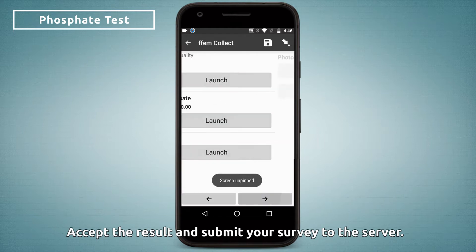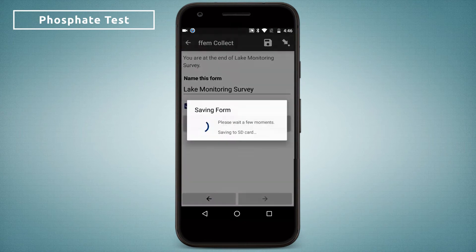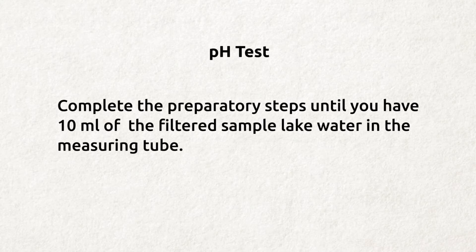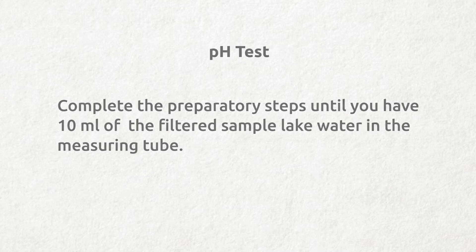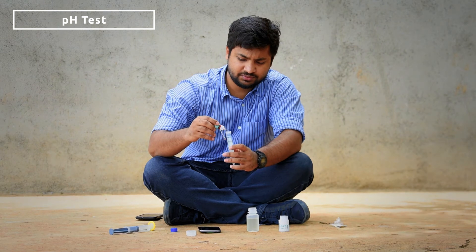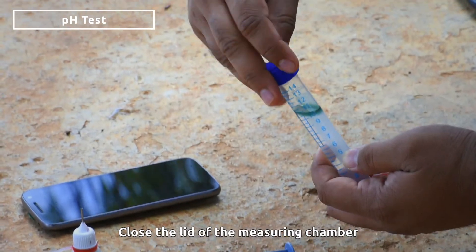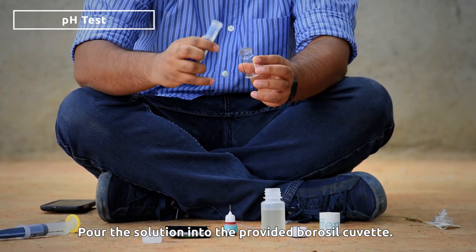Accept the result and submit your survey to the server. For the pH test, take the dropper of pH reagent and add 5 drops to the sample. Close the lid of the measuring chamber and shake it to ensure that the reagent and the sample mix thoroughly. Pour the solution into the provided borosil cuvette.